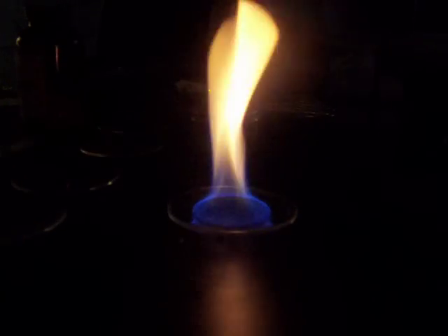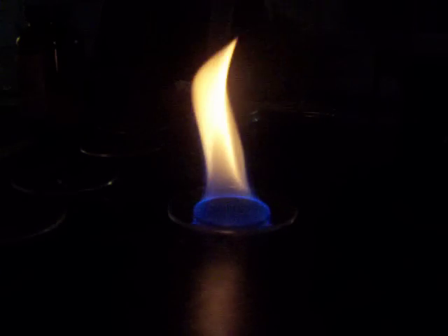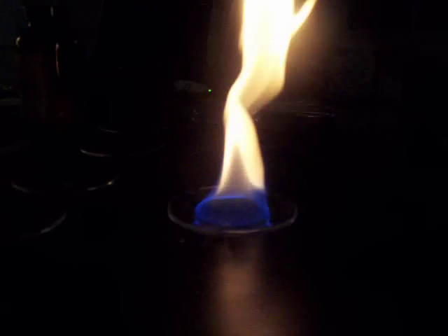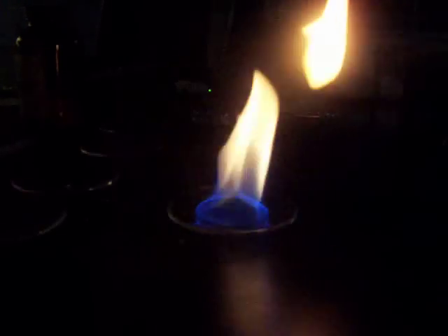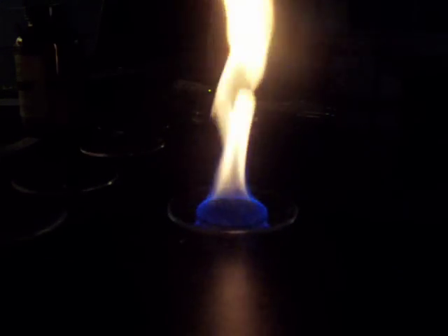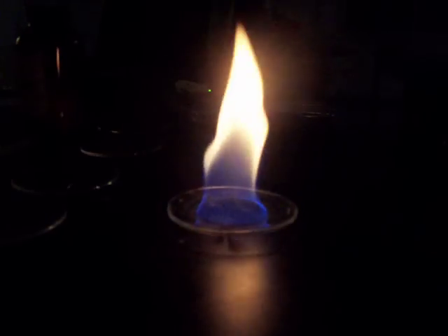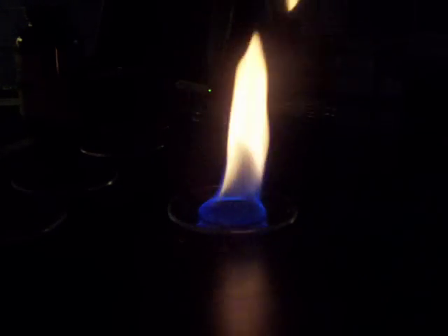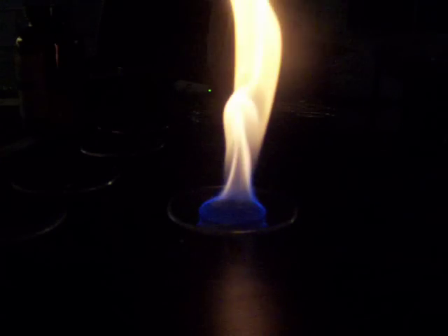Having said that, I have had a few of these break in the past during this demonstration, so hopefully not, but it is possible. Put just a little bit of the alcohol on there. This is so simply you can see the color of the alcohol flame without seeing all of the other colors — to see the inner flame. This is the alcohol alone.